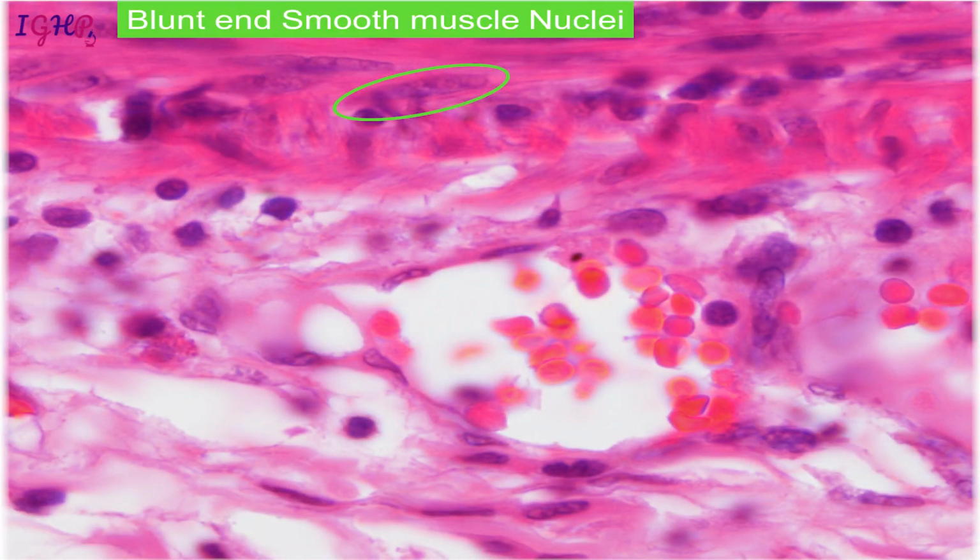These are the cells which are showing elongated plump nuclei. Plump is, we will say, when they are thick nuclei. These are thick, vesicular nuclei, and they are blunt at each end. So these are most likely smooth muscle cells, and they have got abundant eosinophilic cytoplasm, as opposed to the cells which you see here. These are a little wavy, they have little cytoplasm. The cytoplasm is not as eosinophilic as we see on the top. So these ones are the muscle cells, and these ones are the fibrocytes.